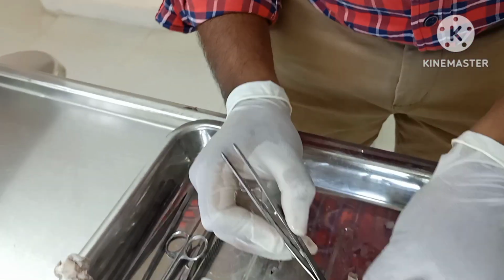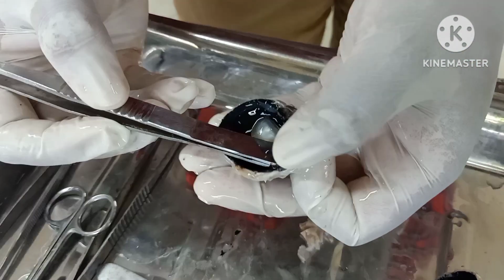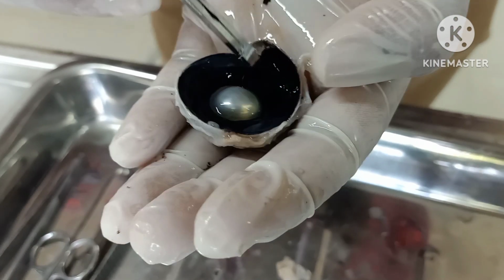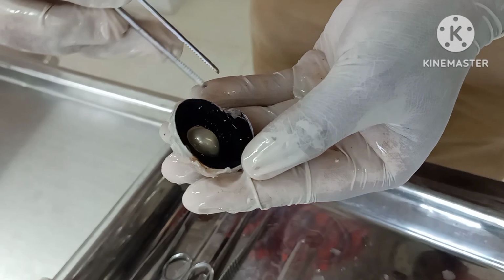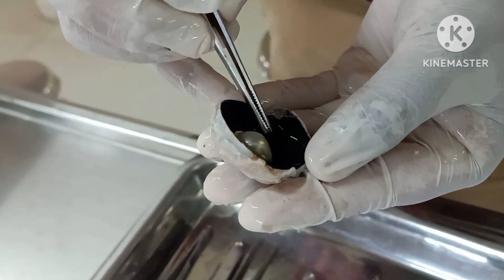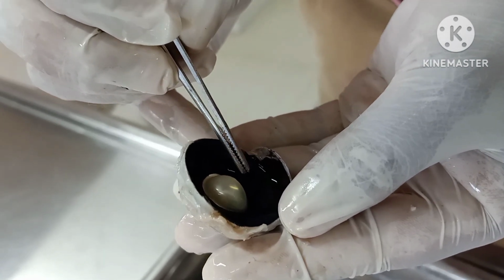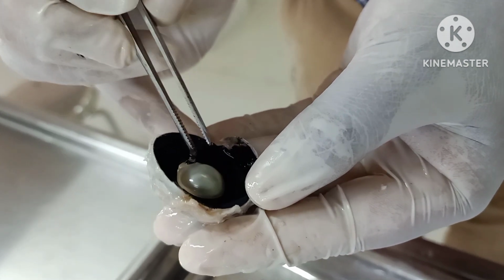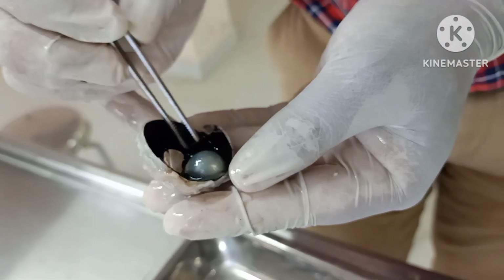So once you reflect this vitreous humor, the blackish colored structure what you are seeing will be called the ciliary body and the iris. If you see here, this blackish structure with irregular elevations, like streaks, this is the ciliary body. From the ciliary body there will be small ligaments called the suspensory ligament of lens, which will attach this lens. So this lens is held by a ligament called the suspensory ligament, which is getting attached to the ciliary body.